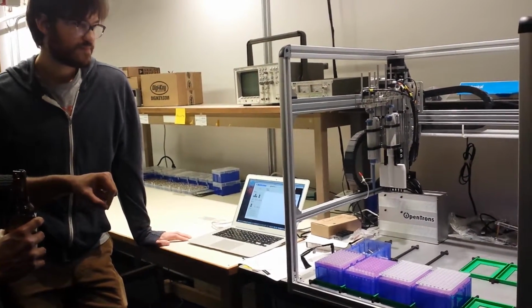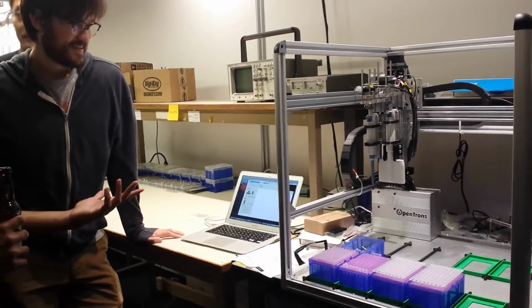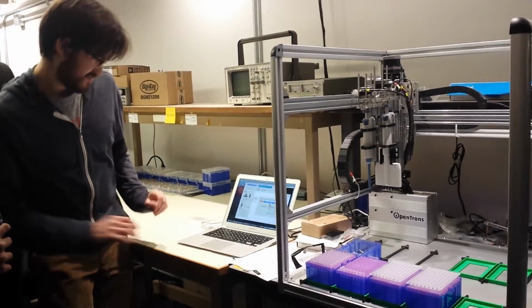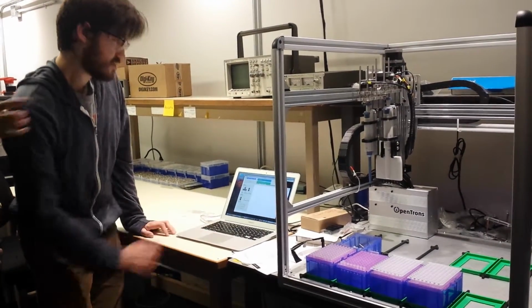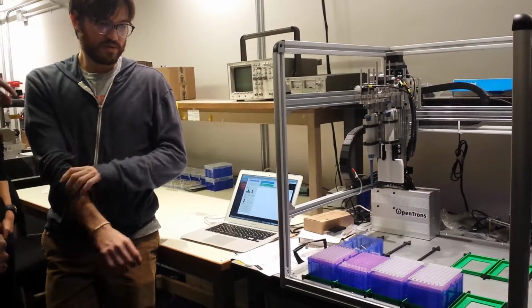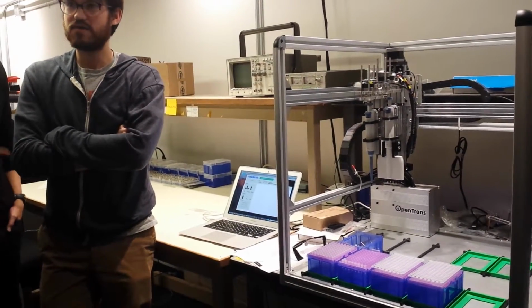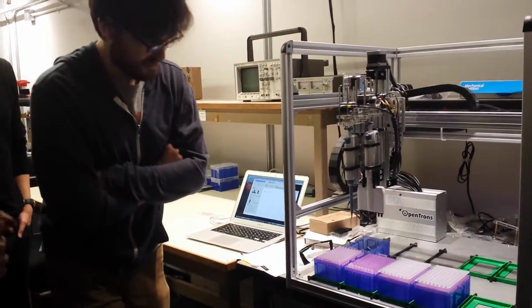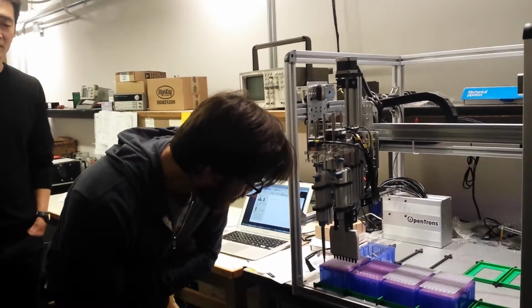How do you write? So this is like, how do you do this with these pipettes? So the different states the DNAs are in have already been generated and put into the different wells in the plate. Okay. And we're just taking a subset of those and mixing them together. It's a combinatorial encoding strategy. Okay, so it's not like one bit per C, A, T, G or something? No, it's completely different. Okay. That's the first thing I thought of when you started presenting.